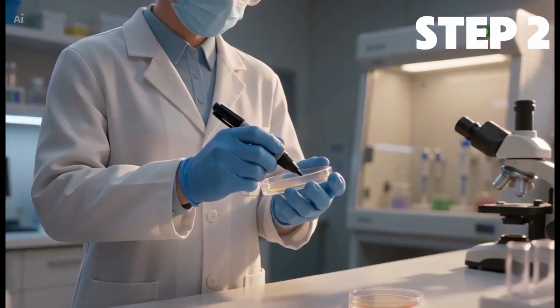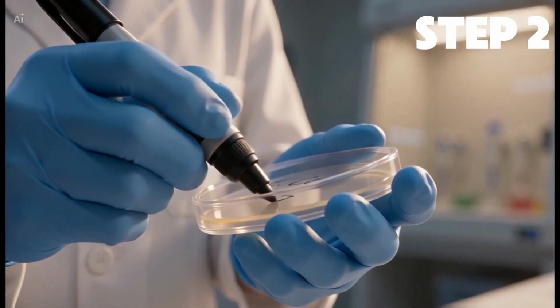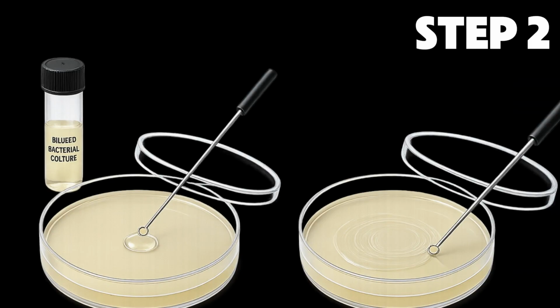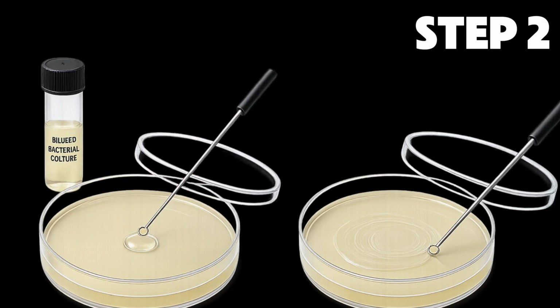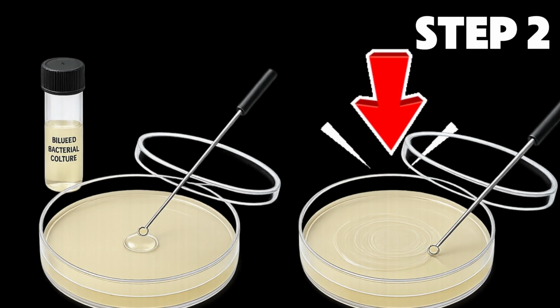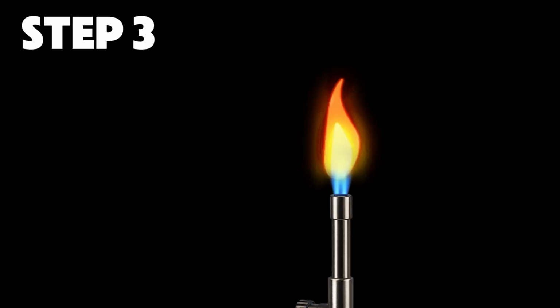Step 2. Preparing the agar plate. Take a sterile nutrient agar plate and label it properly with the required information. Place 1 drop of sterile water in the center of the agar surface. Then, using a sterile inoculating loop, transfer a loopful of the previously diluted bacterial culture into the water drop and mix it gently.